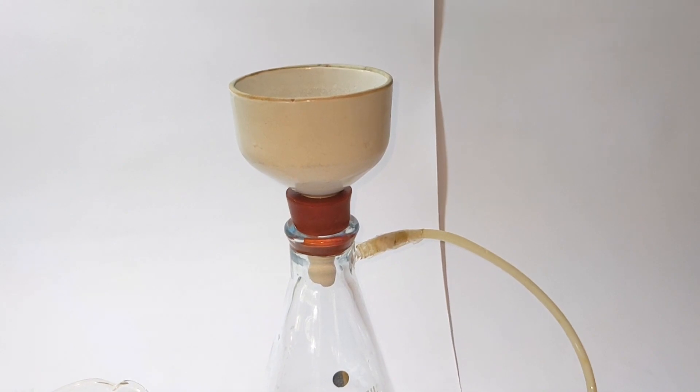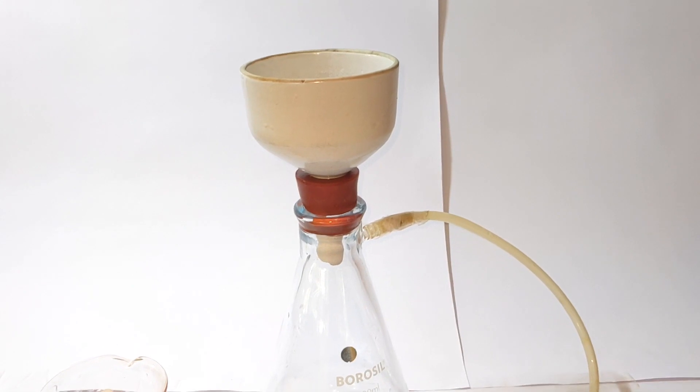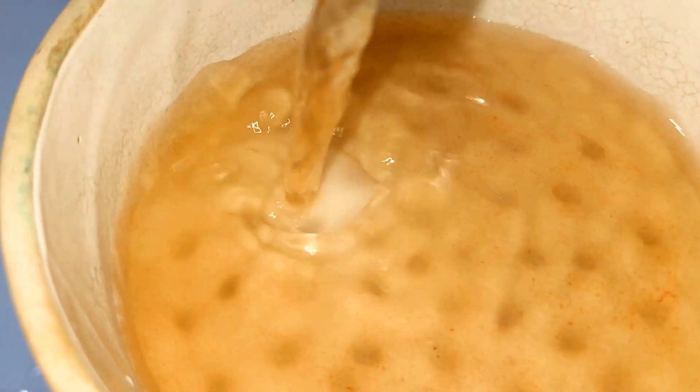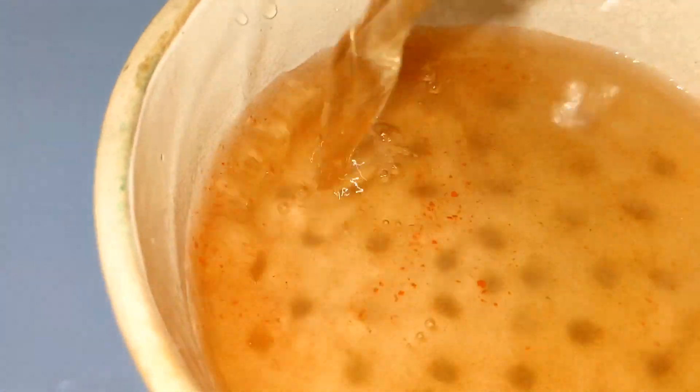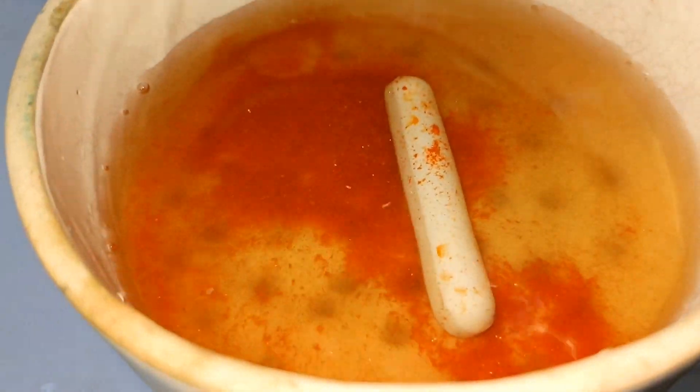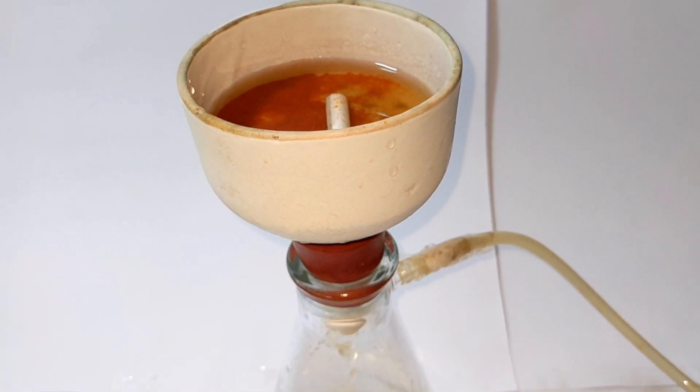Finally the solution was vacuum filtered to collect the crude crystals. You can also use gravity filtration method. The water will easily get passed through the filter paper pores, but since I have access to the vacuum filtration setup now, I use the Buchner funnel for that.